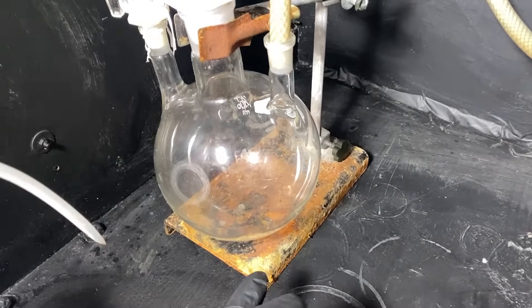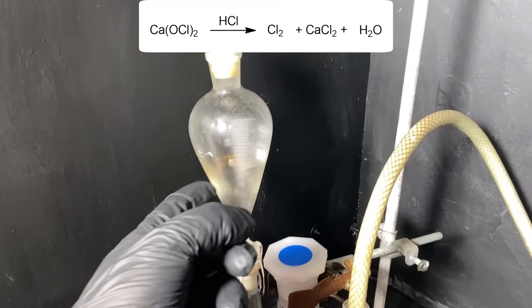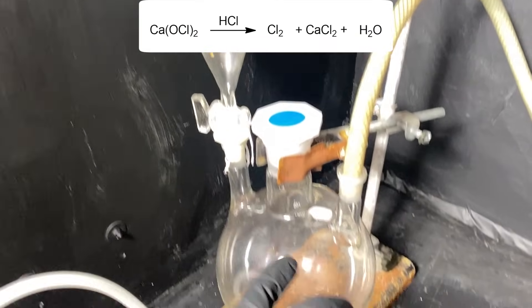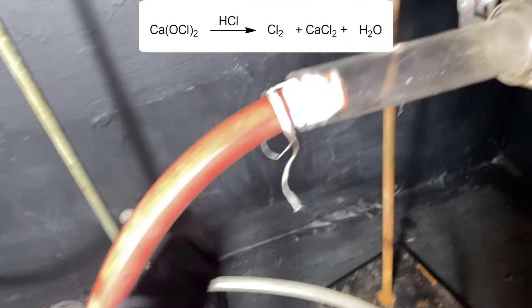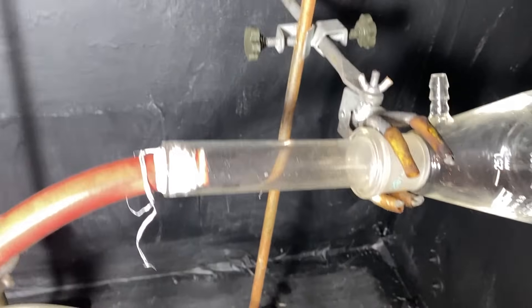In very basic terms, here's going to be some chlorine pool tablets, here's going to be some hydrochloric acid. This is going to drip in and generate some chlorine gas. The chlorine gas will get through this pipe here, and this is where it will meet with our red phosphorus.